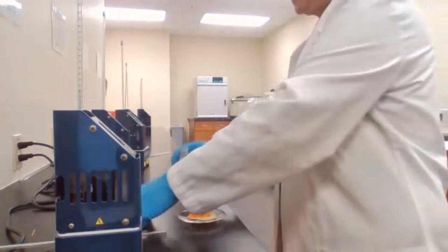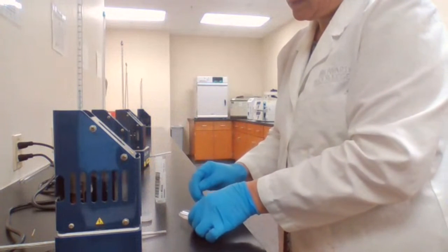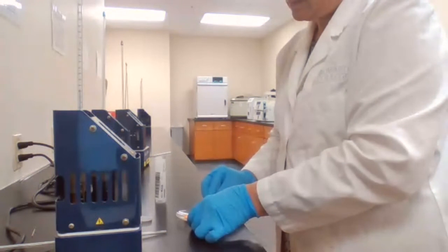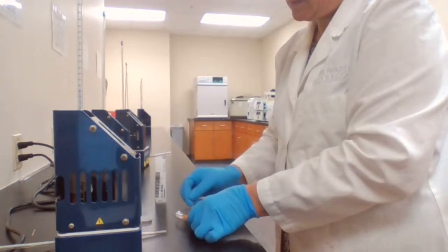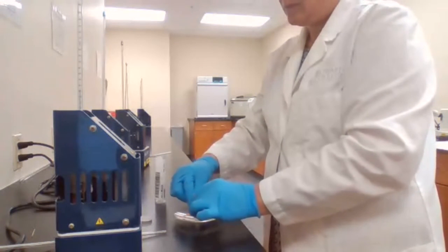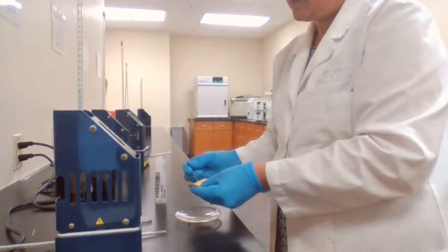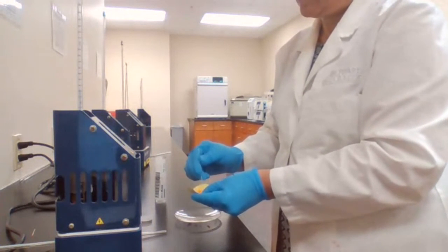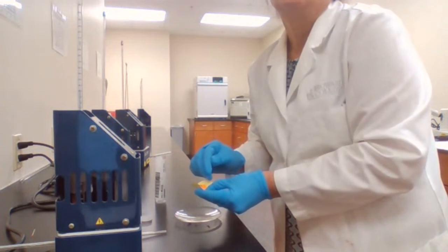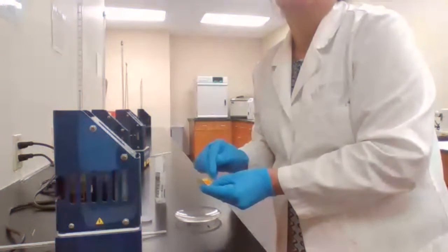Going to prepare samples. Iodoform was negative. Okay.